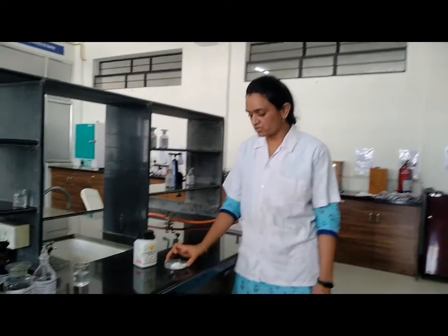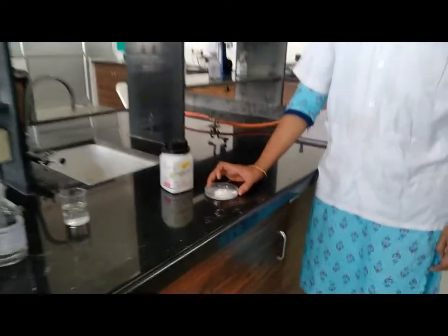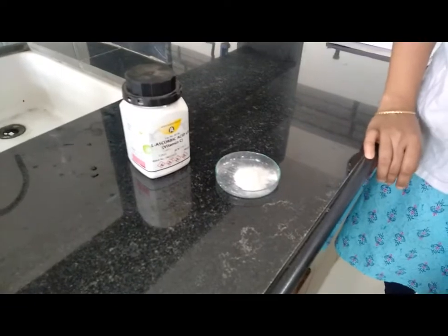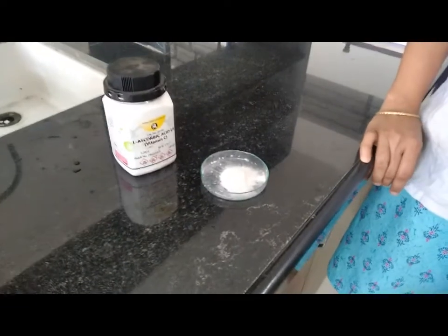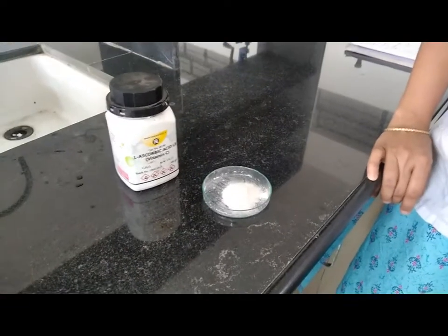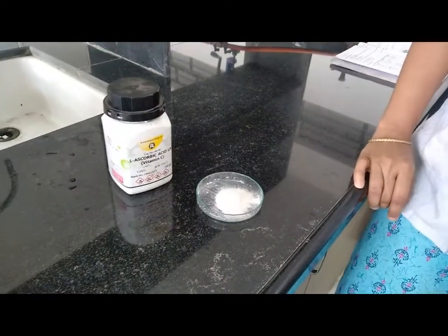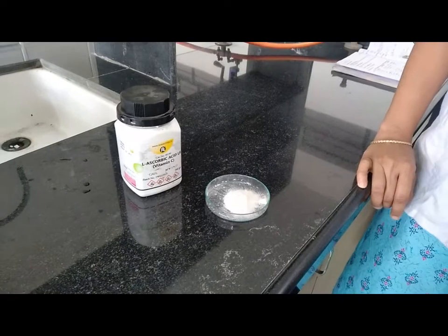This is the ascorbic acid powder. It has a crystalline powder nature, white to pale yellow color, and it is an odorless powder.